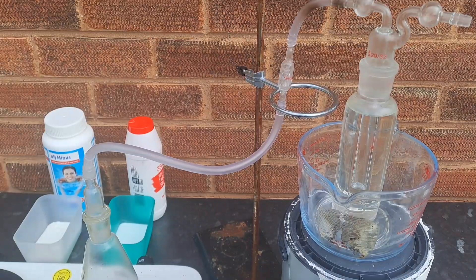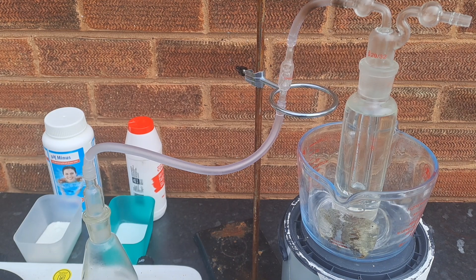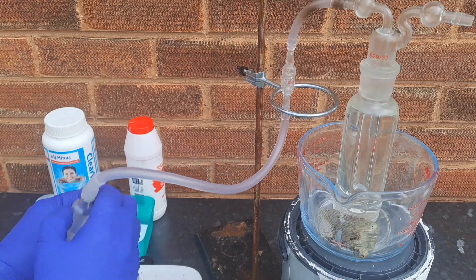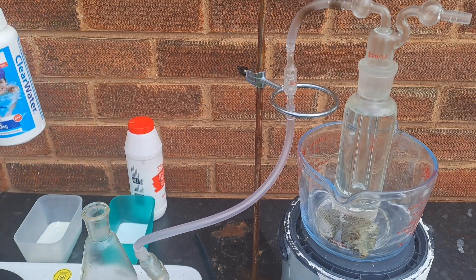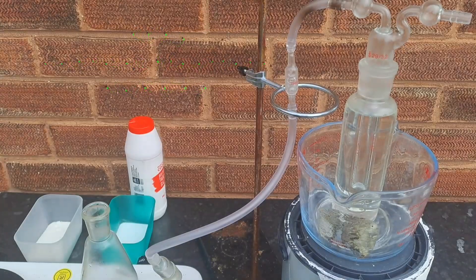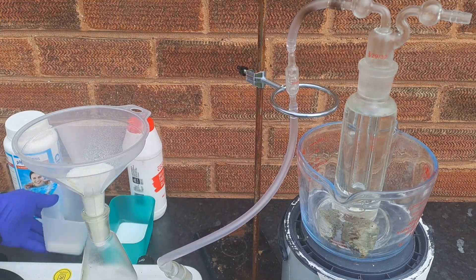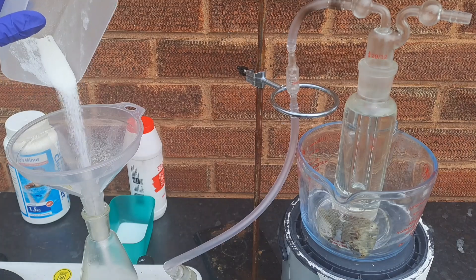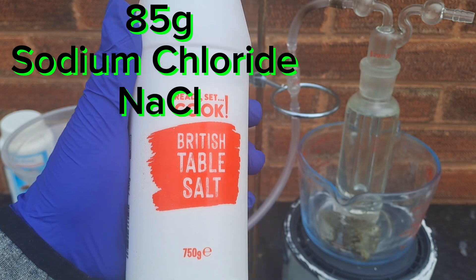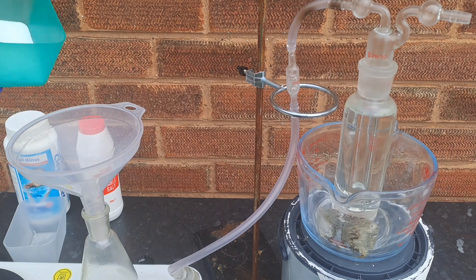To push the concentration of the acid beyond its azeotrope, hydrogen chloride gas needs to be generated and bubbled through the dilute 20% acid, or through distilled water if you're making hydrochloric acid from scratch — the process is the same. To do this, I'll be using 170 grams of sodium bisulfate, which is sold as a pH lower chemical for pools — use 350 grams if you are making fresh acid. Next, add to the flask 85 grams of table salt. It just needs to be sodium chloride. If you are making fresh acid, you will need to use 170 grams.